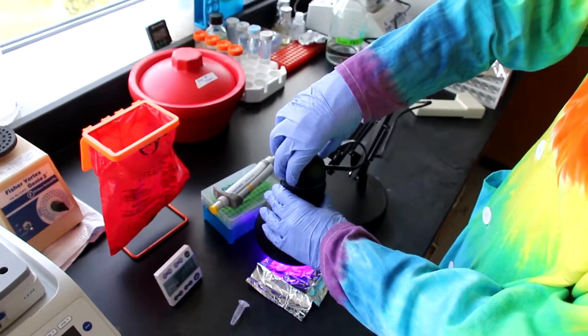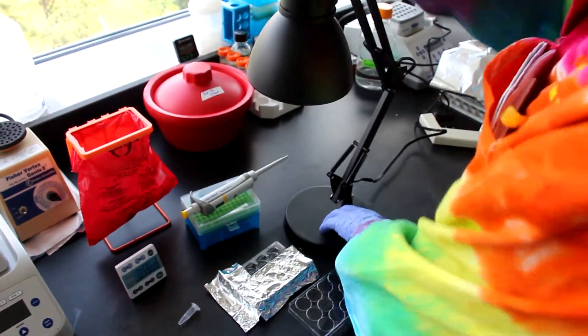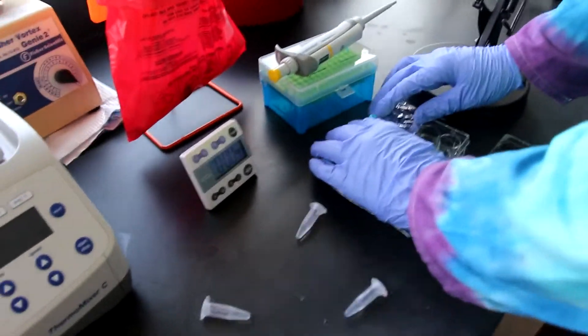When you're done photoconverting experimental vehicle, again move the foil so that experimental treatment wells only are exposed.